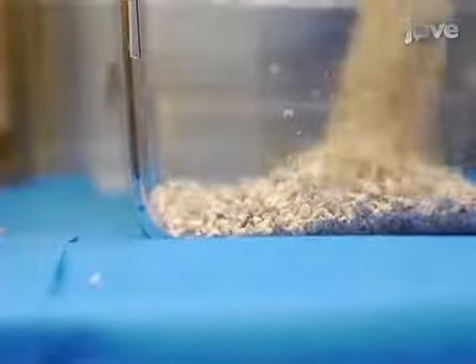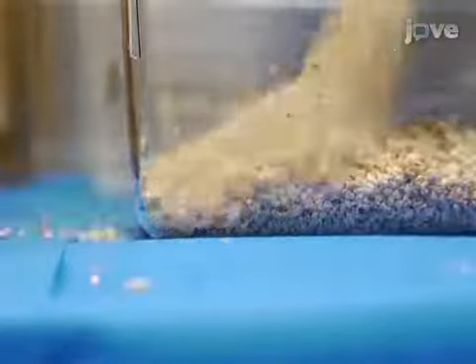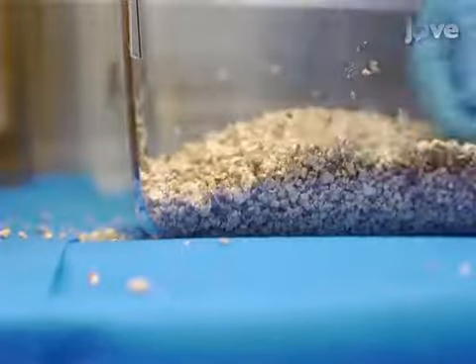During habituation, fill a clean cage with clean bedding to 3 centimeters high and make sure that the bedding is evenly distributed throughout the cage.